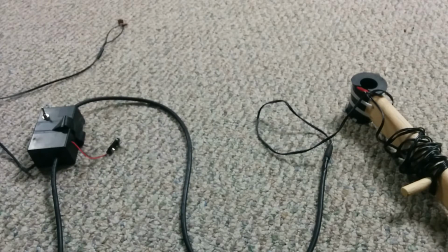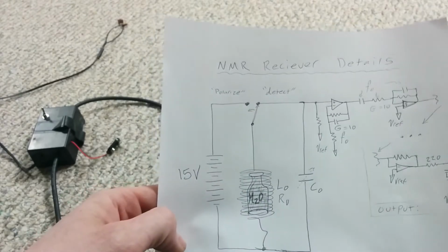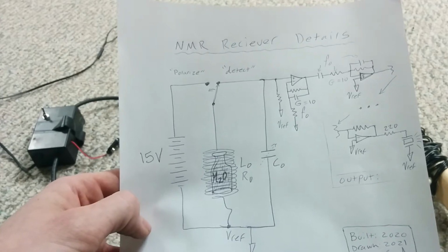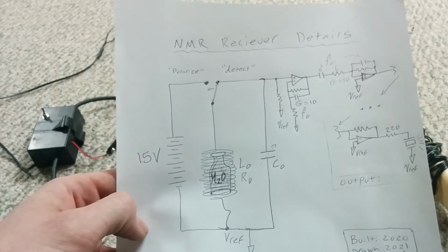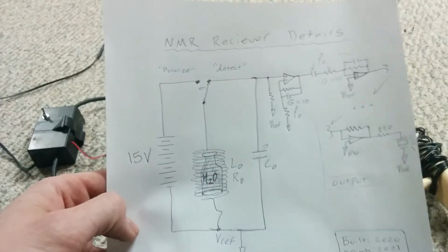here's the circuit here. I'm going to try and show you this in a way where it's stable, so you might be able to pause the video if you're interested in this stuff. And I'm going to warn you that I actually built this circuit completely improv. Like, it was never drawn. I've recovered this from memory, and you may be able to see that there are some gaps here.